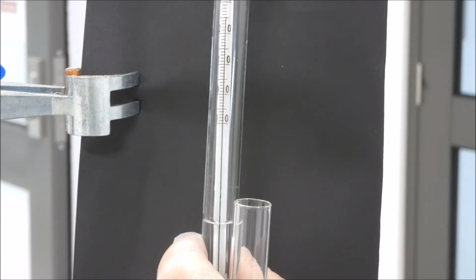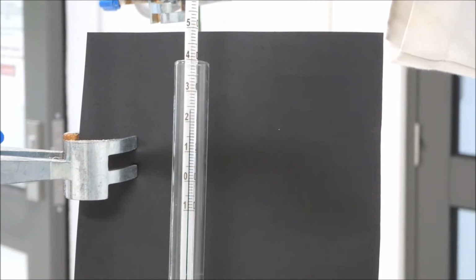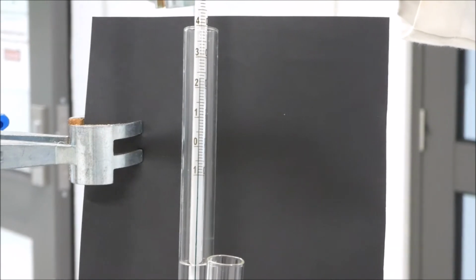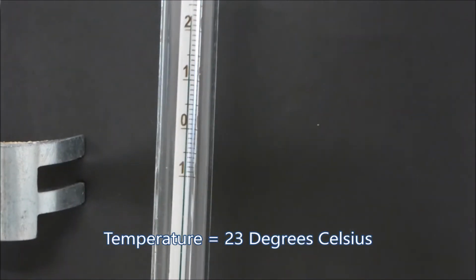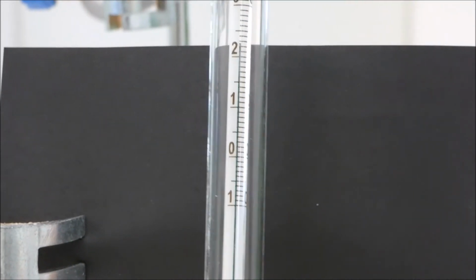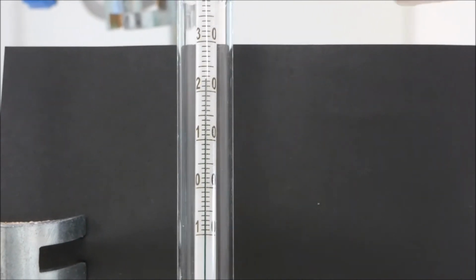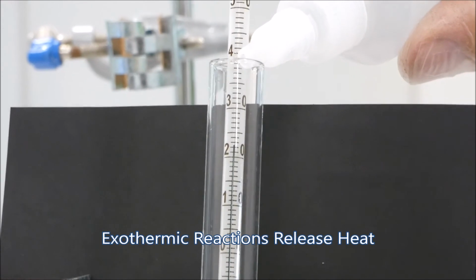We'll add a fair bit so we can get a reasonably accurate measure of how much energy is in the system. And I hope you can see what the temperature is there. It says it's about 23 degrees or something like that. Now if we get our sodium hydroxide, which is quite strong sodium hydroxide, acid-base reactions create what they call an exothermic reaction. An exothermic reaction releases heat.